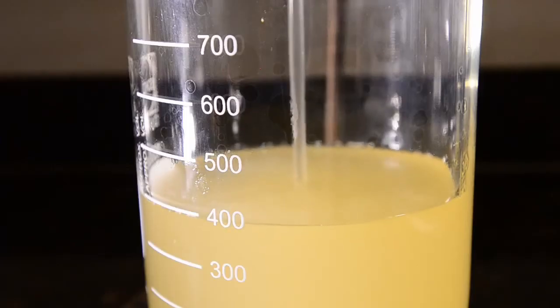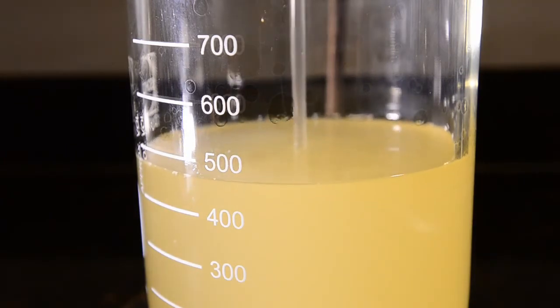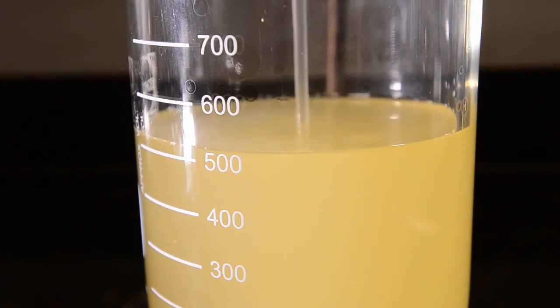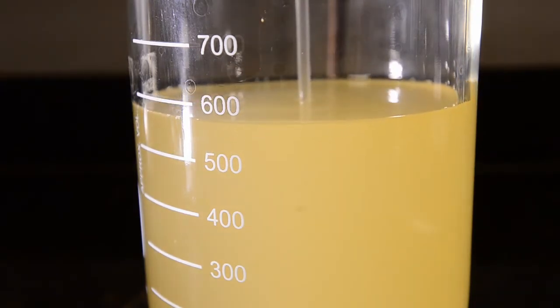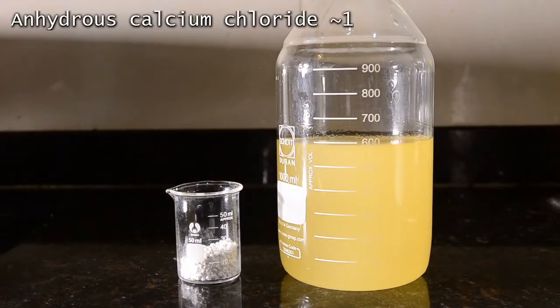You can see that the viscosity is now much less than that of the original starting oil. It's this property which makes the original oil unsuitable as a fuel in a normal diesel engine, whereas the ester works well. We'll use about 10 grams of anhydrous calcium chloride to dry the product.